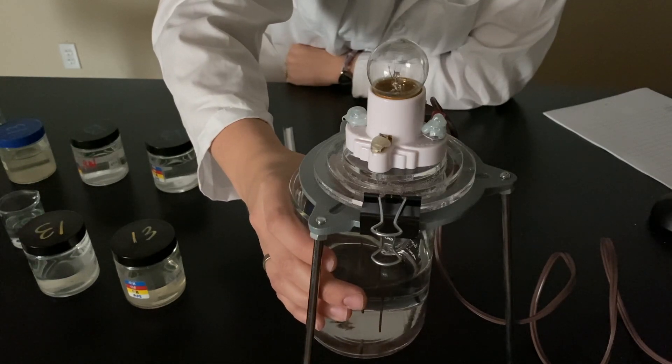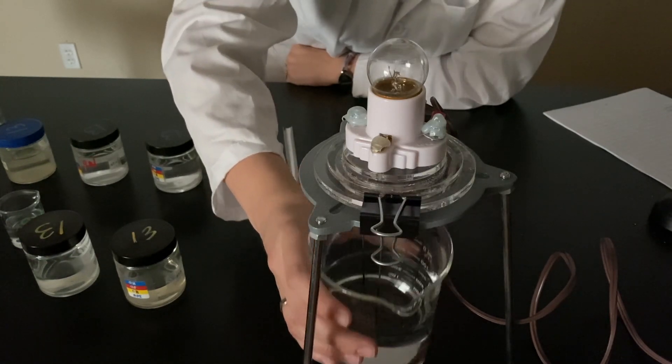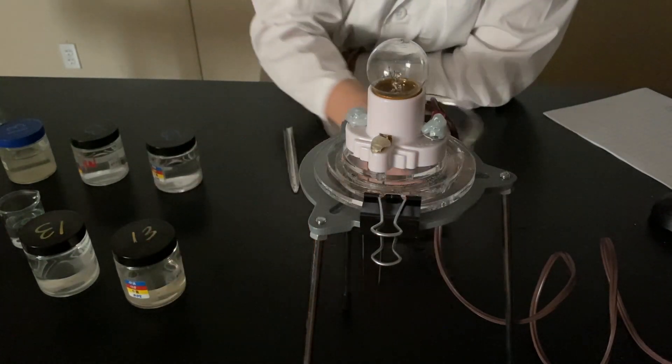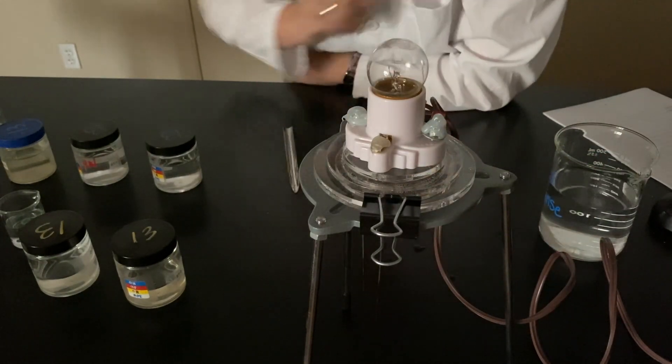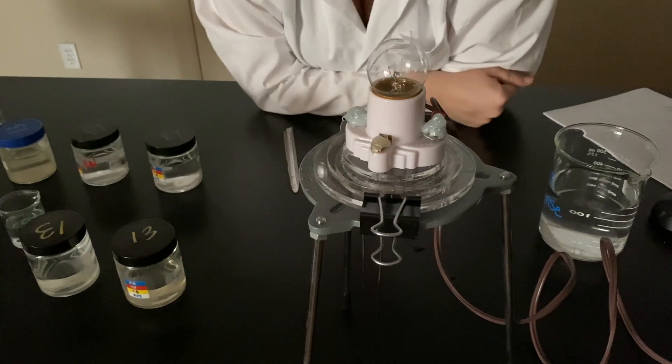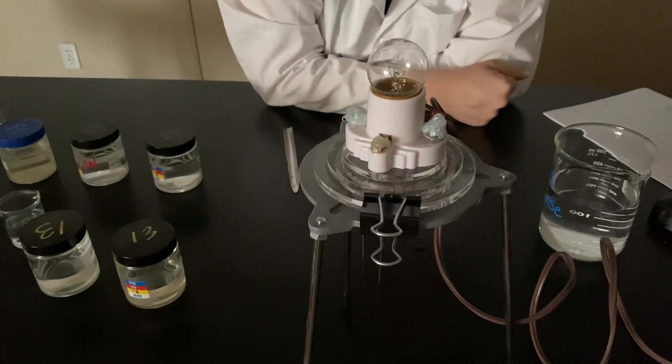Now, this is unfortunately the only one that we are missing. I do not have any saturated calcium hydroxide for us, just because of how everything is kind of off on this strange coronavirus situation.